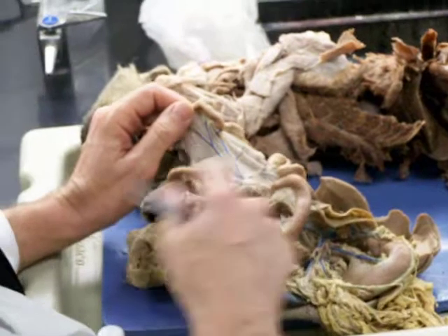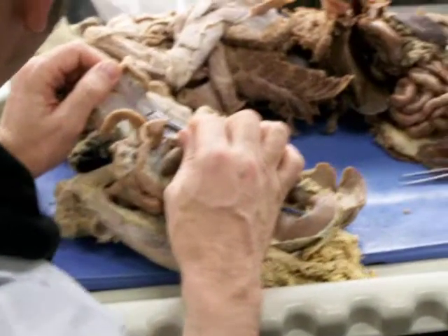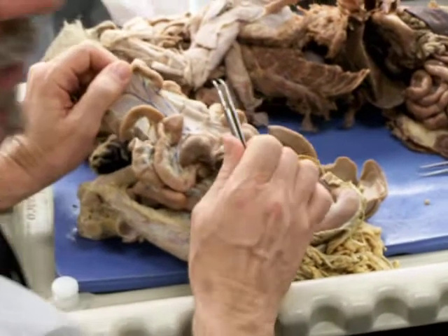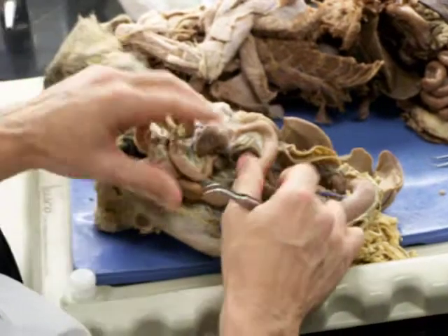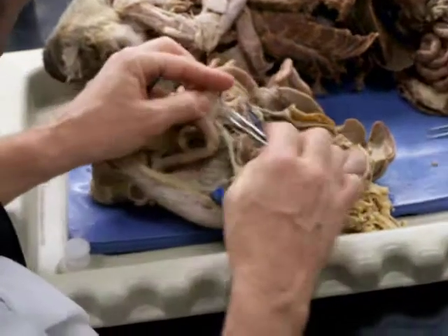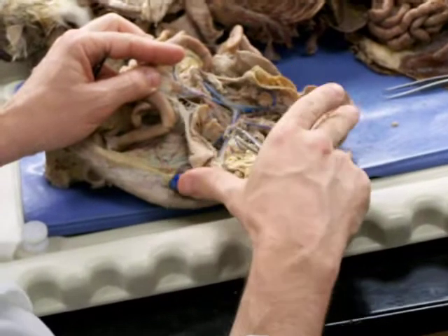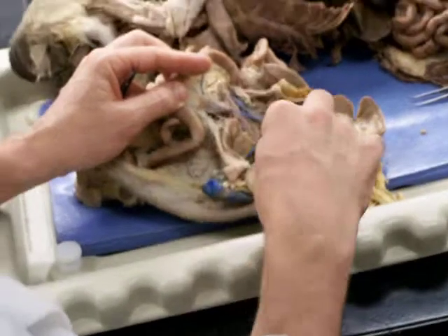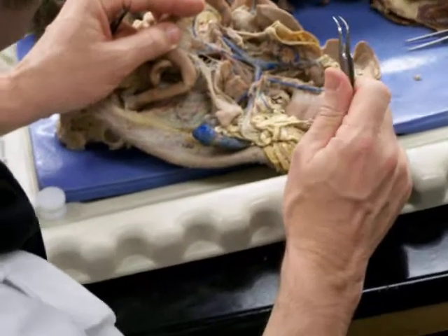Okay, so chances are, with the jejunal, it's pretty easy because if they're going to be here, and if you call that a jejunal vein, or if you call those arteries jejunal arteries, those would be pretty easy. The others, I'm going to try and have it clear so that you can see the relationships. And one nice thing about this prep is that you can lay these out and you can see all the way from the hepatic portal vein down to each of those terminal venous branches.